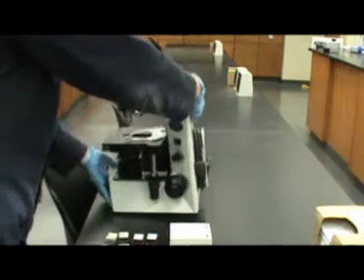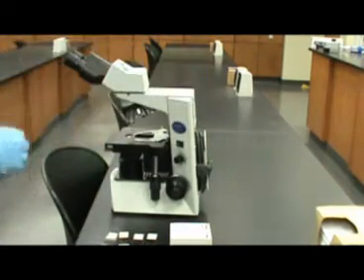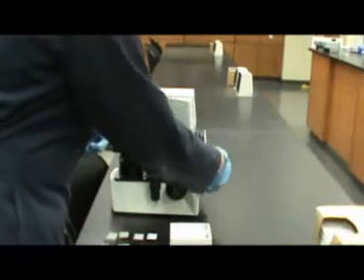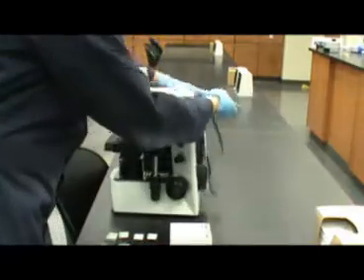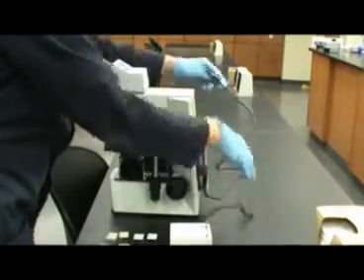When handling the microscope, it is important to hold it by its handle and support the base with your free hand. Gently set the microscope down onto the table, unwind the cord and plug it in. Make sure to keep the cord behind your workspace.